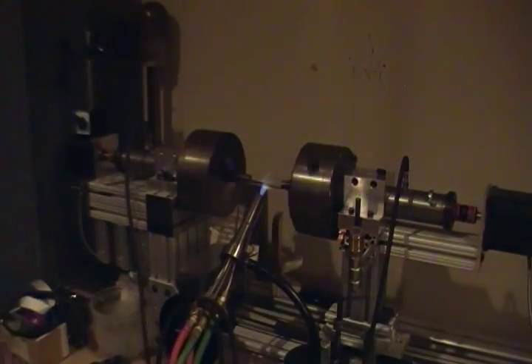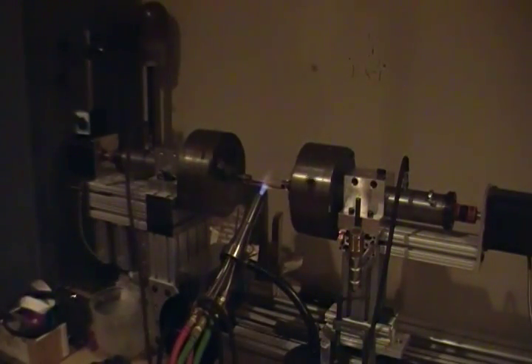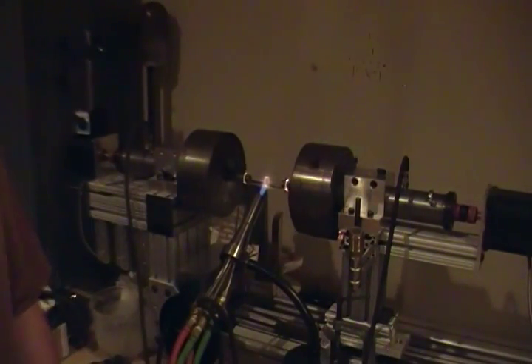One of the main things with quartz is cleanliness. It's absolutely imperative that the piece be clean. You get something called devitrification. Any carbonaceous compounds or oils, fingerprint oils, or anything that get on the surface, at the flame, at the temperatures that you're working the material, that oil will actually break down the silica bonds and destroy the characteristics that quartz is so prized for, its optical and mechanical properties, and it makes it porous and translucent and just not very pleasant. So we keep everything very clean.